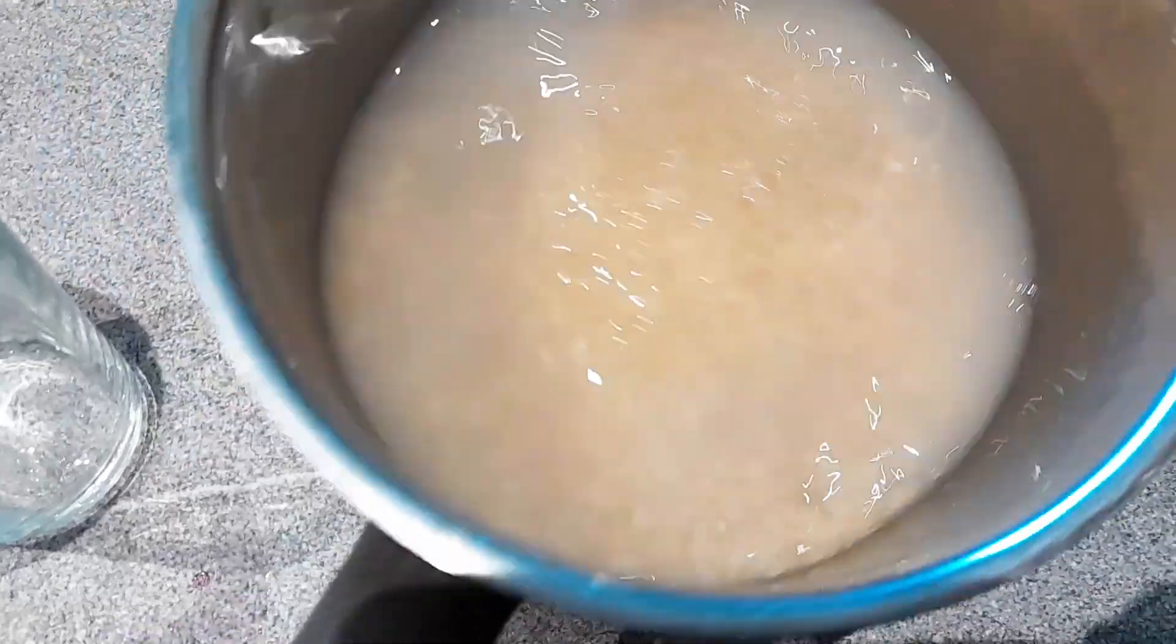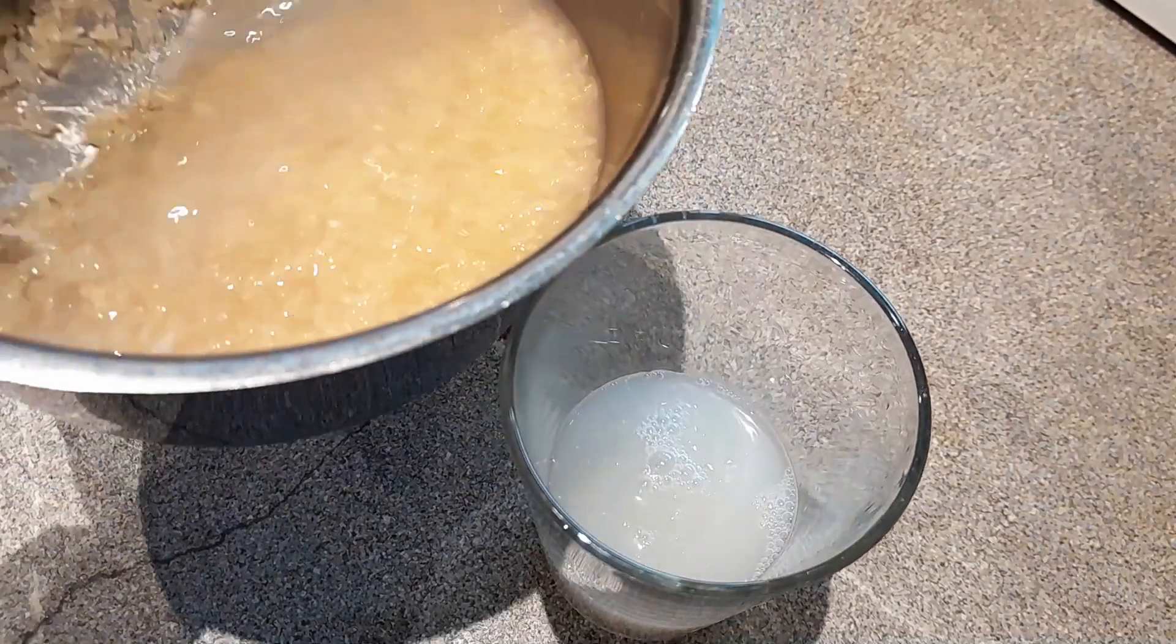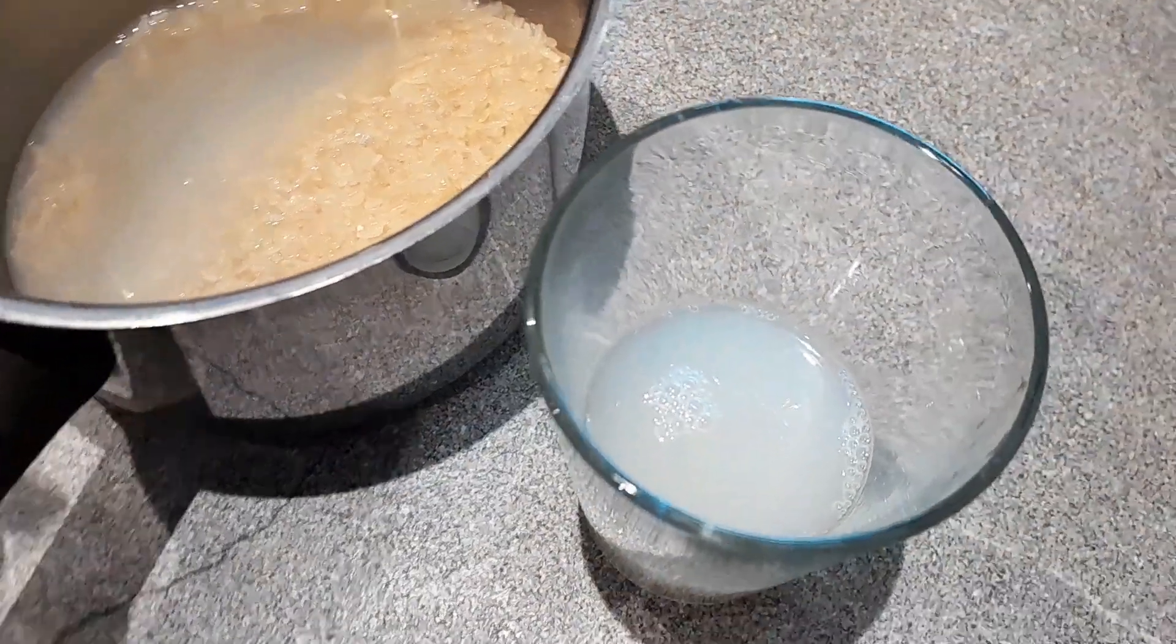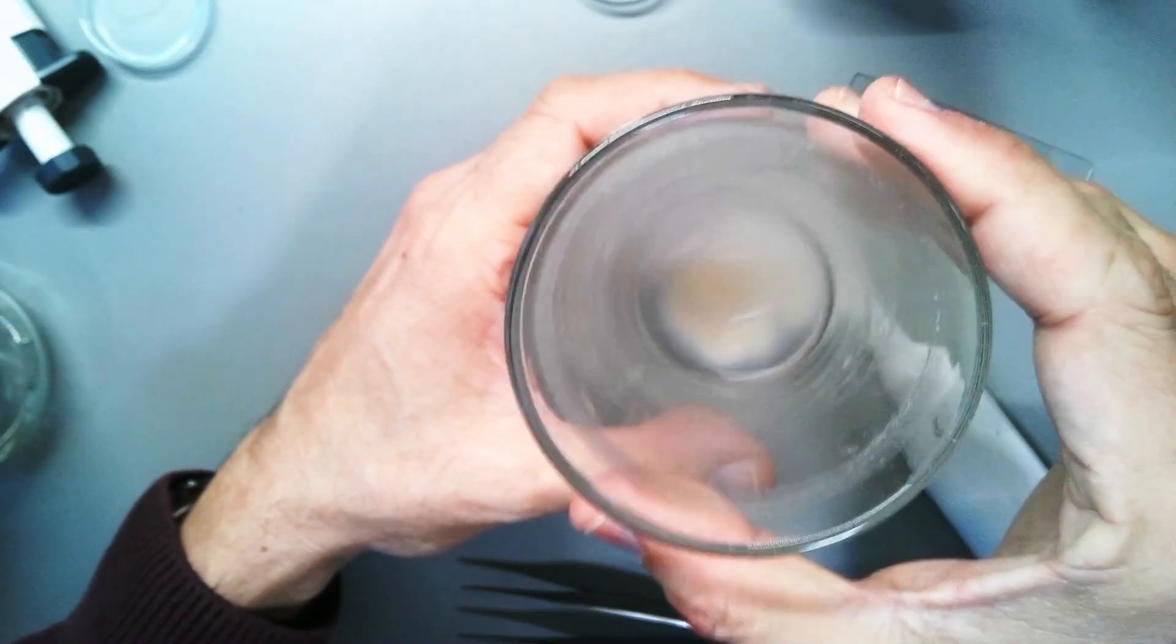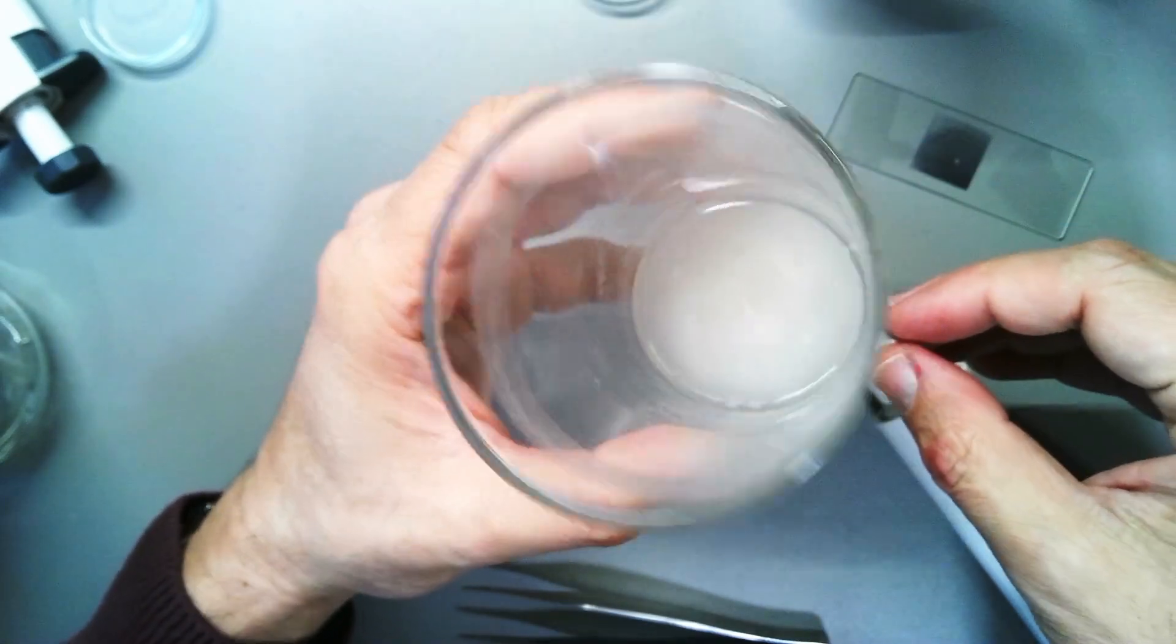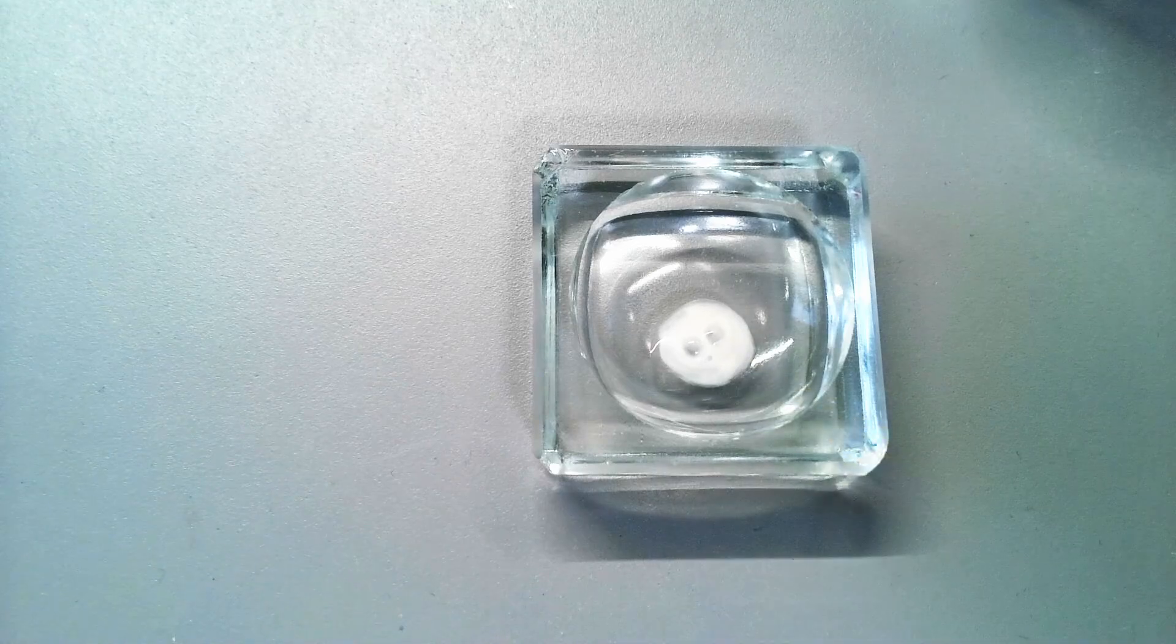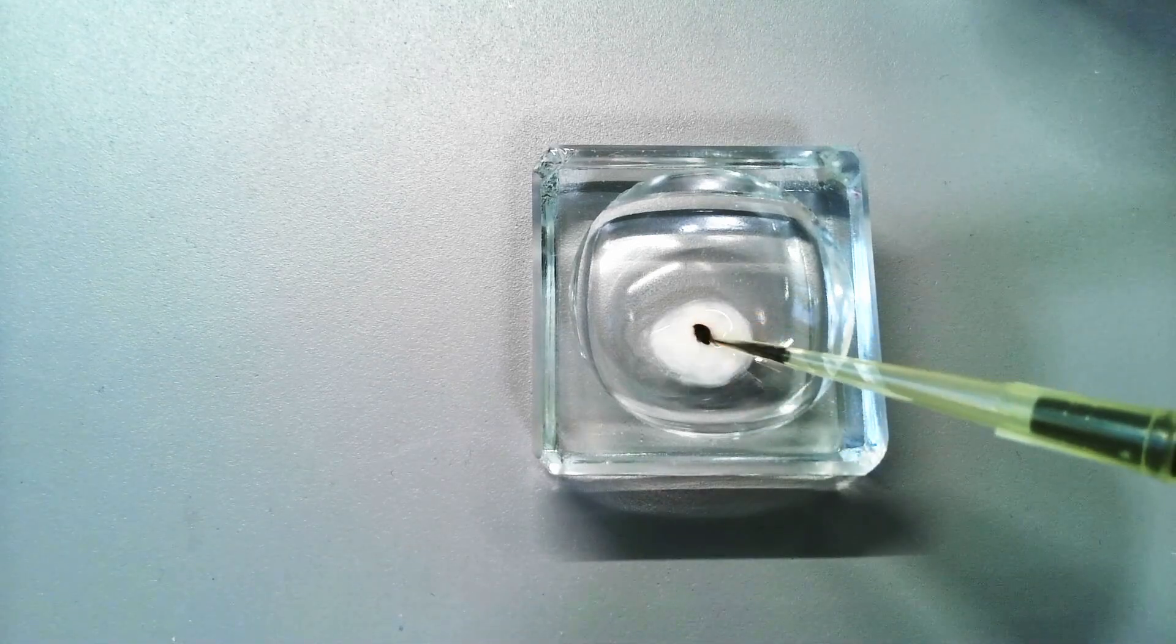So what I've done is I've basically collected some of this water and I allowed the starch to settle for approximately two days. When it was concentrated enough, I decided to take a small sample from this starchy water.